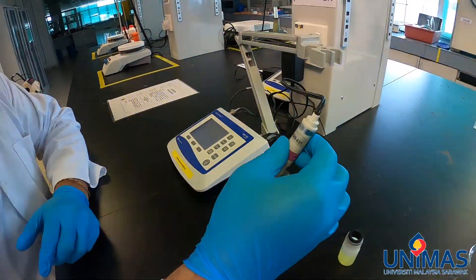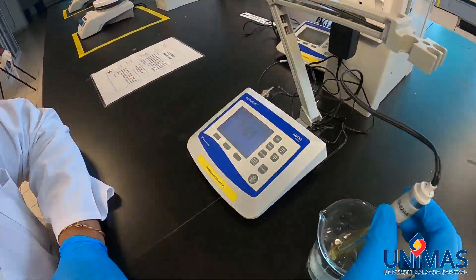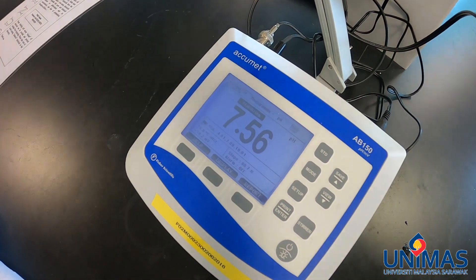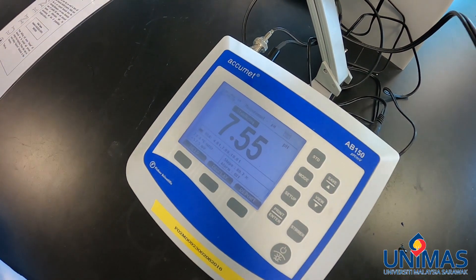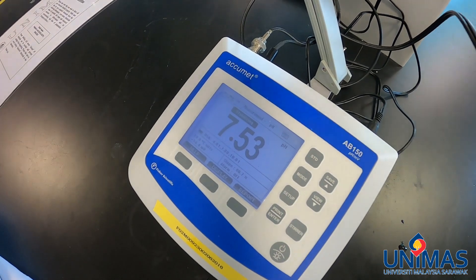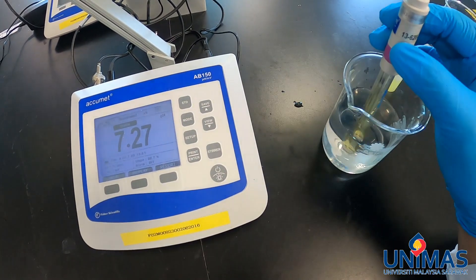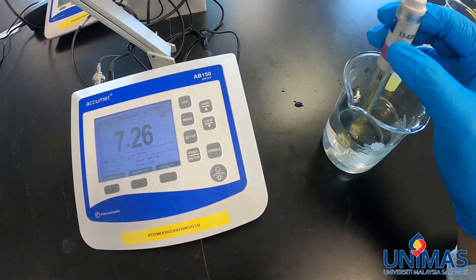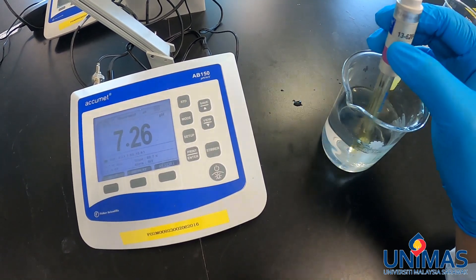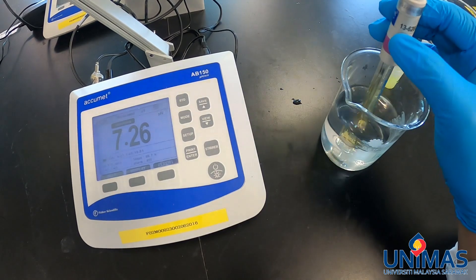Currently the pH is dropping, so we need to wait for it to stabilize first. We can see that the pH of the water is between 6 and 8.